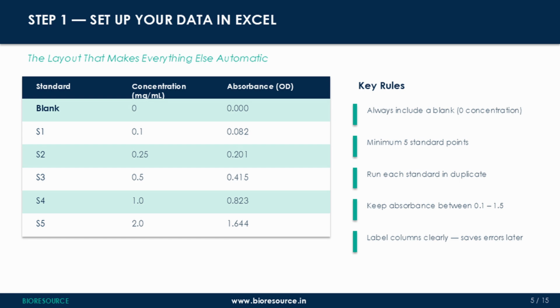Step 1 is setting up your data correctly in Excel. This sounds straightforward, but getting it wrong at this stage causes problems downstream. So pay attention to this layout. You need 2 columns, concentration in the first column, absorbance in the second. That's it. Don't swap them. Excel expects the X values, your concentration, in the first column when building this type of chart.